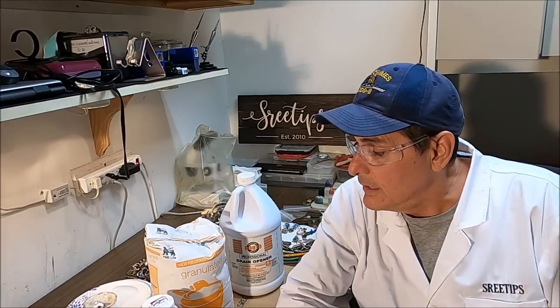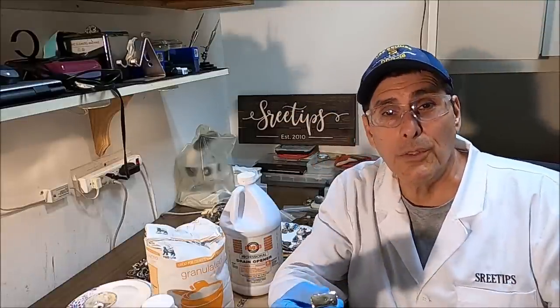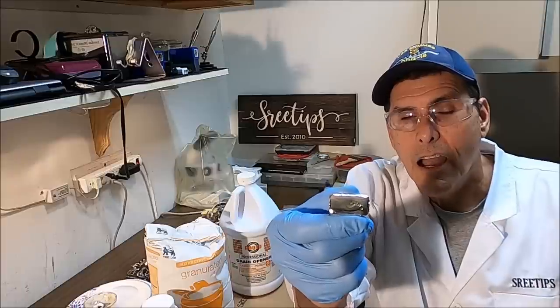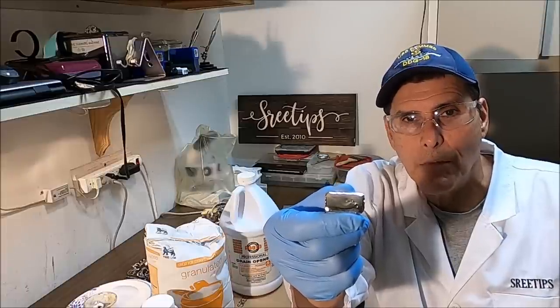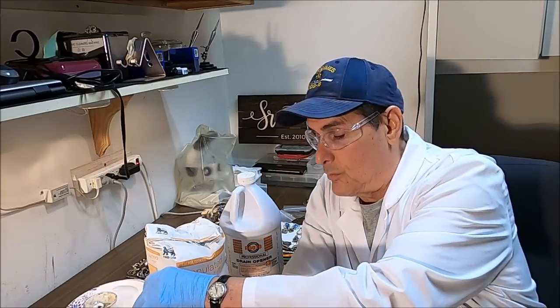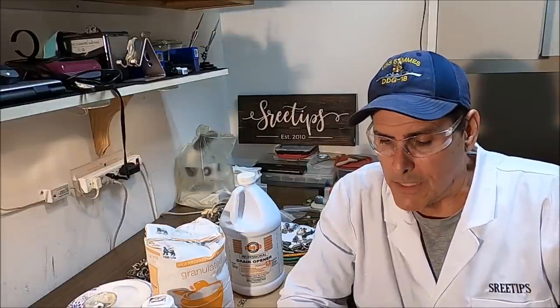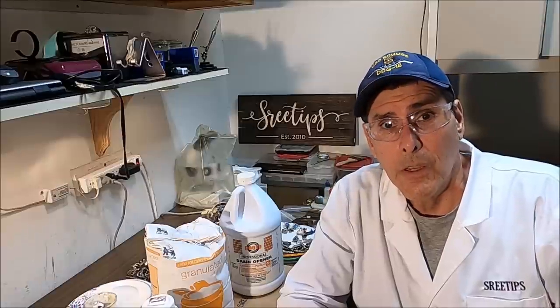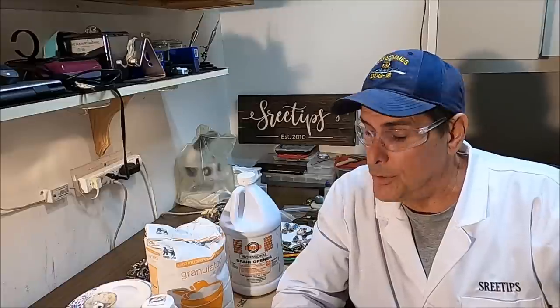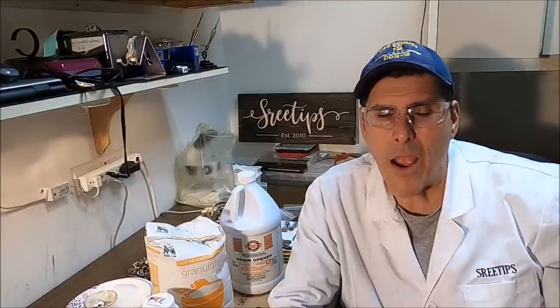Then we're going to use lye and sugar to precipitate out the pure silver from the silver chloride that we'll produce when we add some hydrochloric acid. This is a remake of a previous video I did, but it was very sloppy and the yield was very low — less than half of the actual silver content was recovered. We're going to try to get a much better yield and produce some pure, three-nines fine silver.